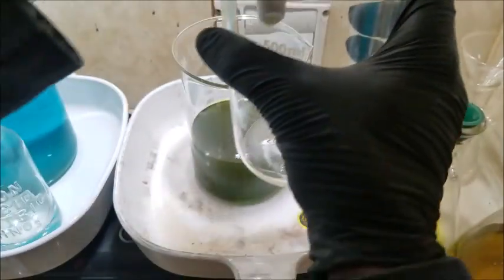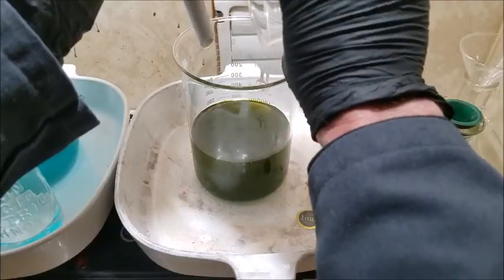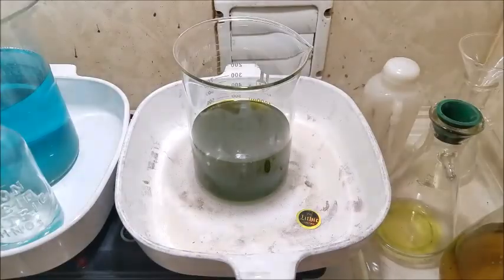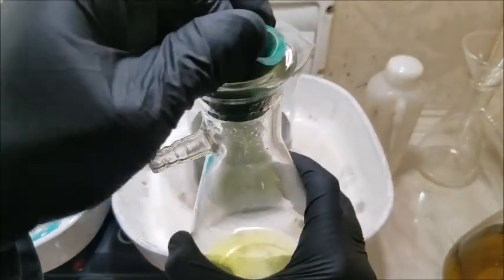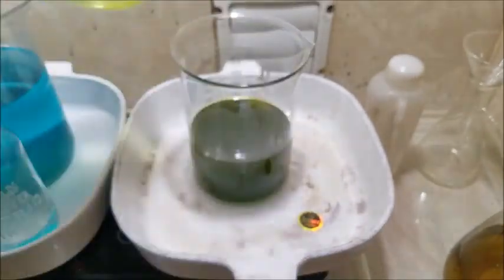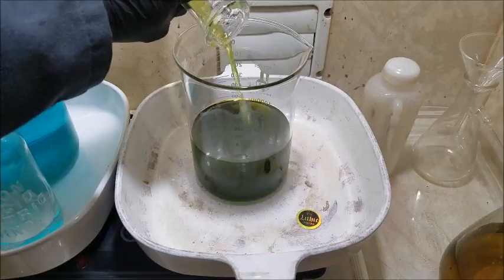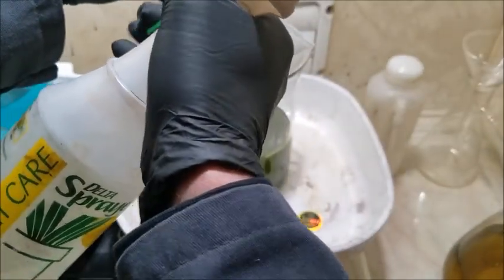I'm going to set this aside here to collect a couple drips. It's pretty watered down. We also have what we pulled off here. Had something be so yellow and so black at the same time.